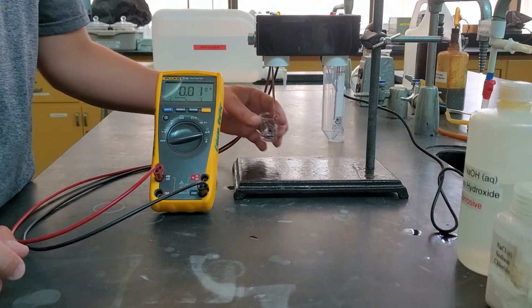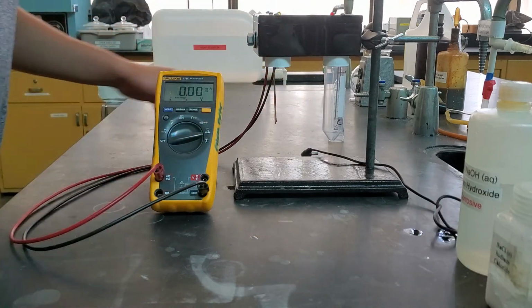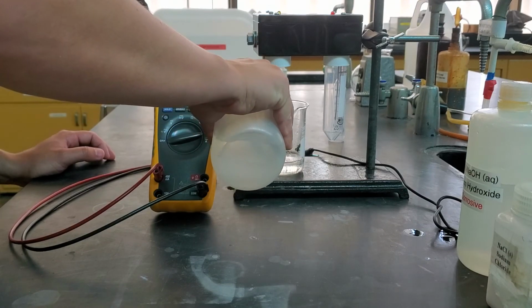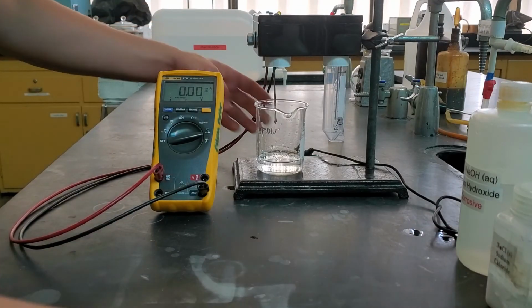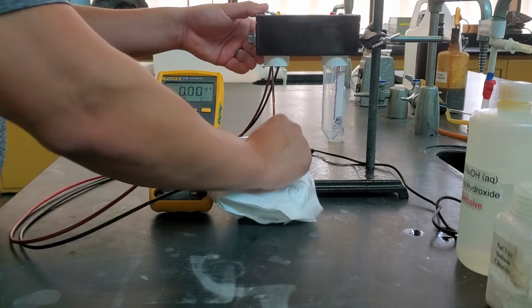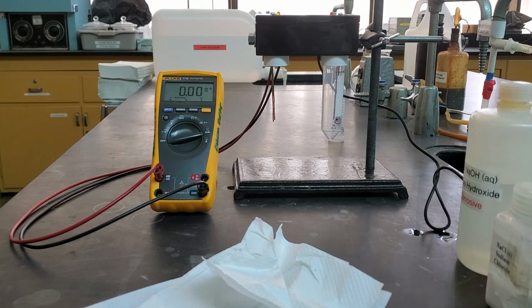When we are putting them in, you can actually see some little bubbles that show up. We see that with the table salt solution, the NaCl aqueous. We see those bubbles show up with the HCl solution, the aqueous acetic acid solution, and the NaOH. We can actually see little bubbles forming, and that's because this box is trying to pass some voltage between these two probes. When enough current gets passed, we can see the bubbles form as it splits that water into hydrogen and oxygen. It's hard to see on the video, but that's what you would see in person.